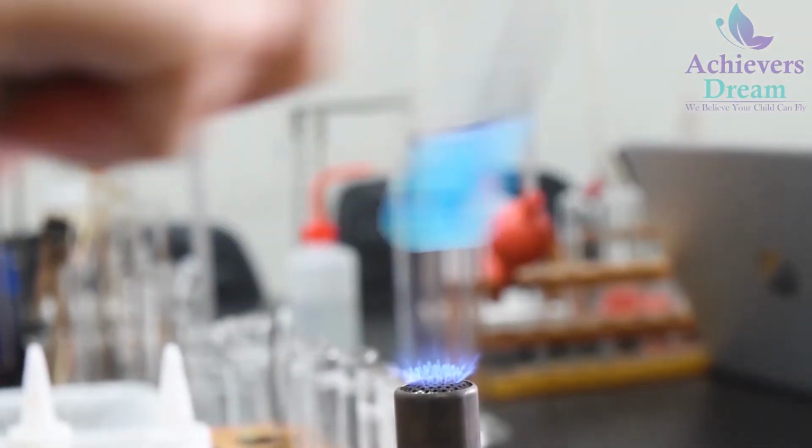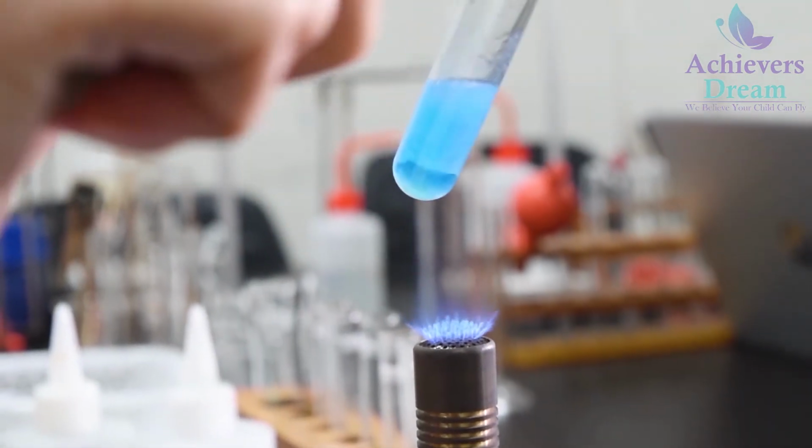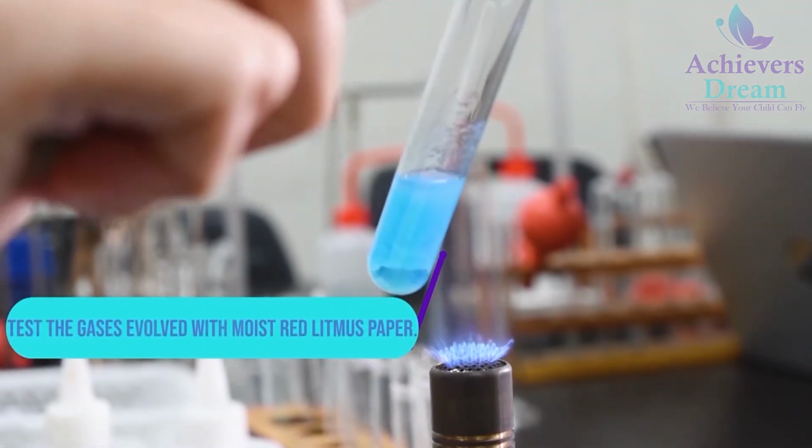I'm going to test the gases evolved with a moist red litmus paper.